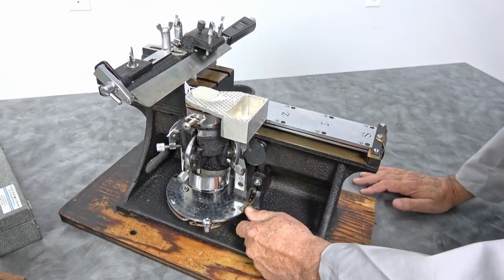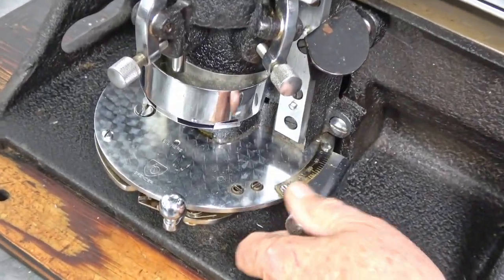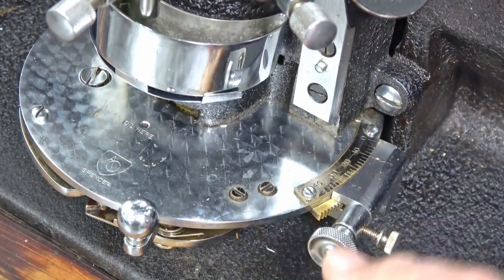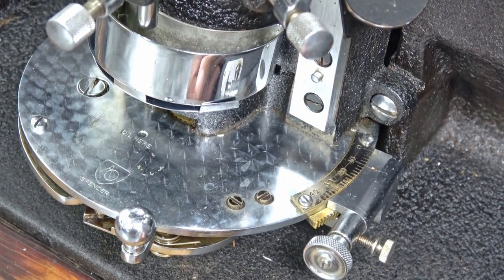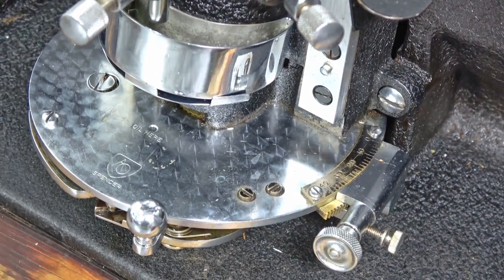Everything works nice and smooth very easily. There's your micron adjustment. We're going out to 10. We were up at what appeared to be two microns. There's 10 and all the way out to 40 with this adjustment.